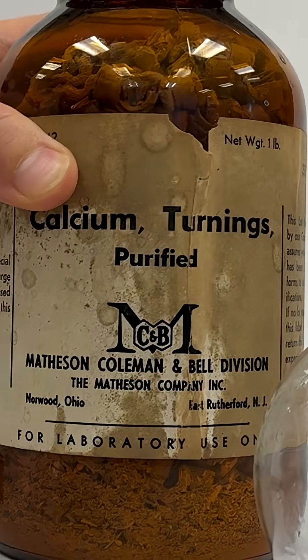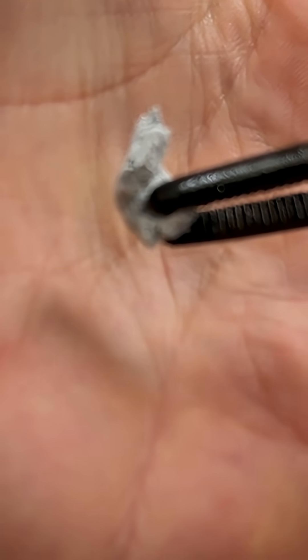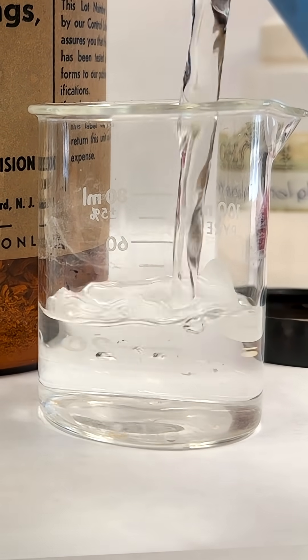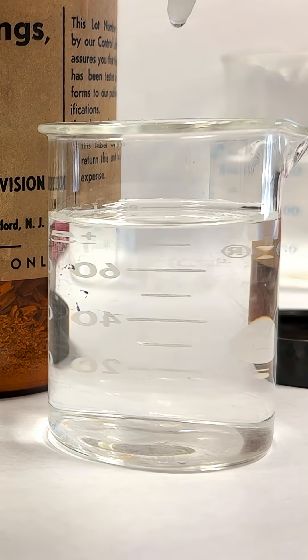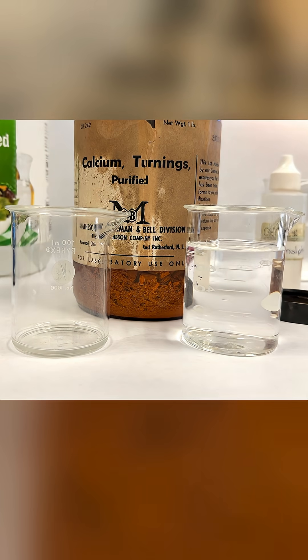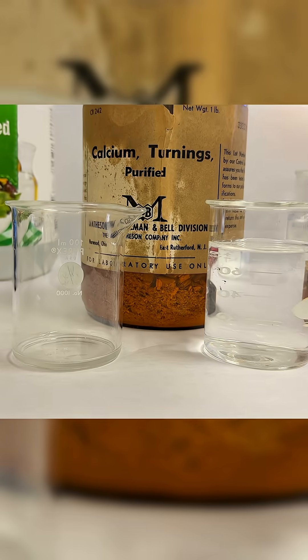Come check it out. I have these little calcium turnings — little pieces of calcium that are slightly oxidized. For this one, I'm going to put water, and let's put a little phenolphthalein. If it turns pink, that means it gets basic.